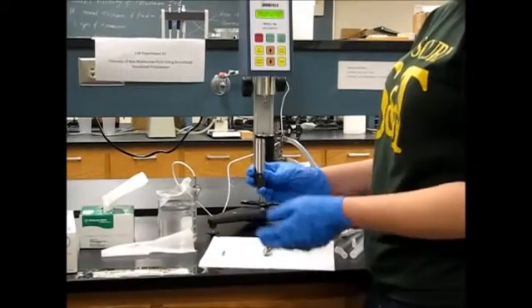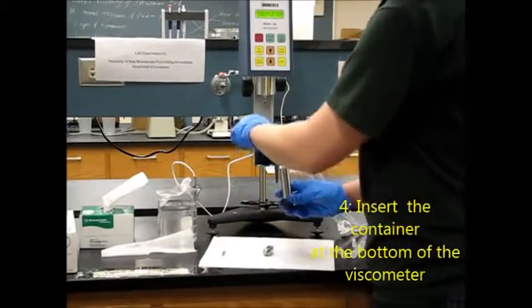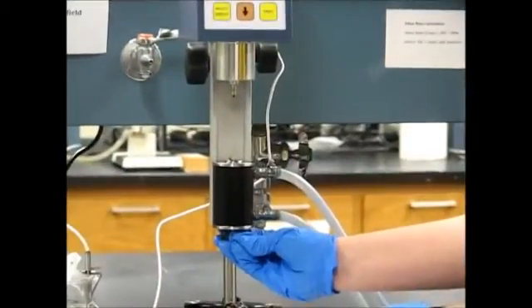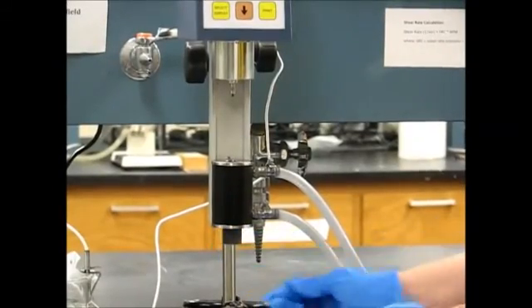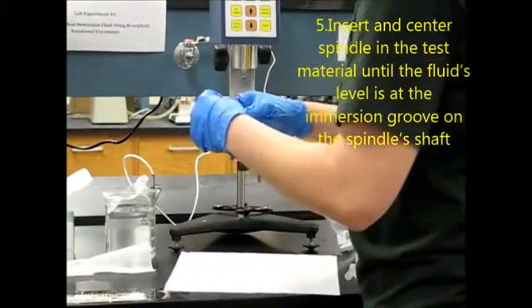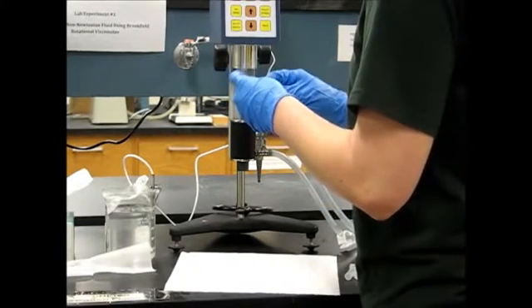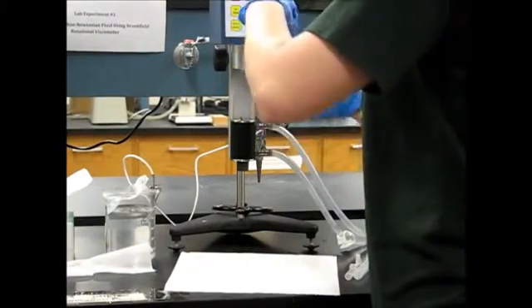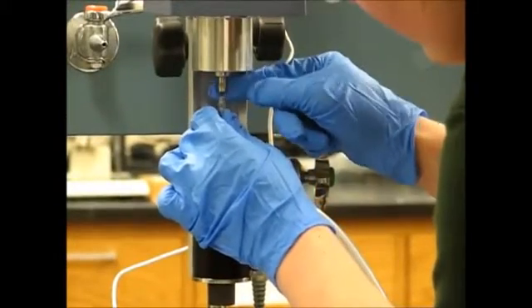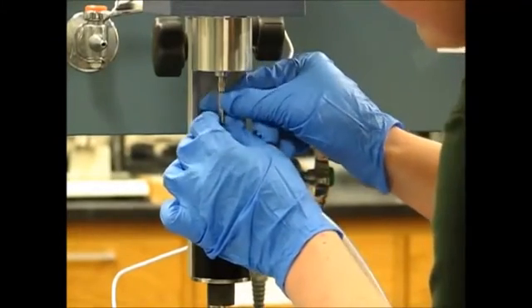Now that our sample container is around 25% full, we're going to go ahead and attach it. There's a little groove which you want to match up with the inside of this container. We're going to place it below, push it up until the grooves match together, and then lock it in place so our sample container won't go anywhere. Then we're going to take our spindle and slowly place it in the sample container, attaching it to the viscometer and tightening in a clockwise motion.